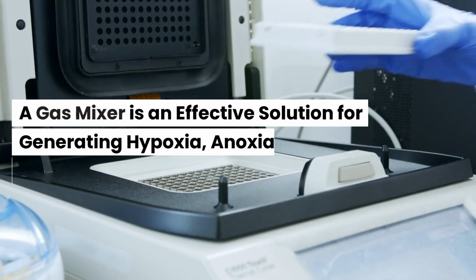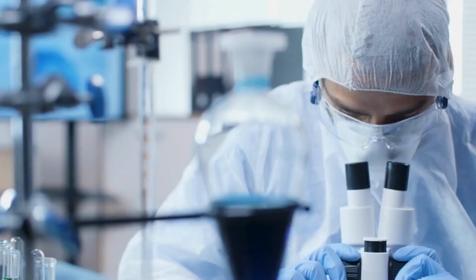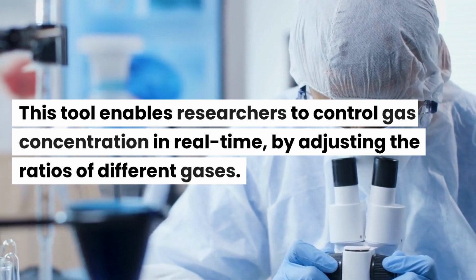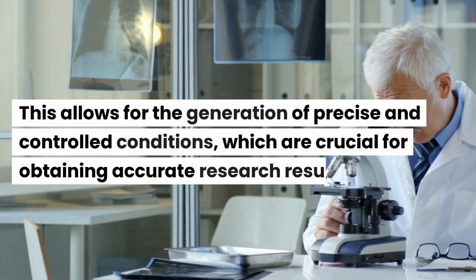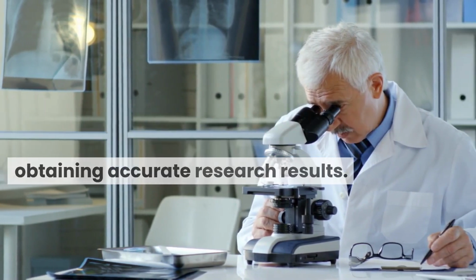A gas mixer is an effective solution for generating hypoxia, anoxia, or other conditions. This tool enables researchers to control gas concentration in real time, by adjusting the ratios of different gases. This allows for the generation of precise and controlled conditions, which are crucial for obtaining accurate research results.